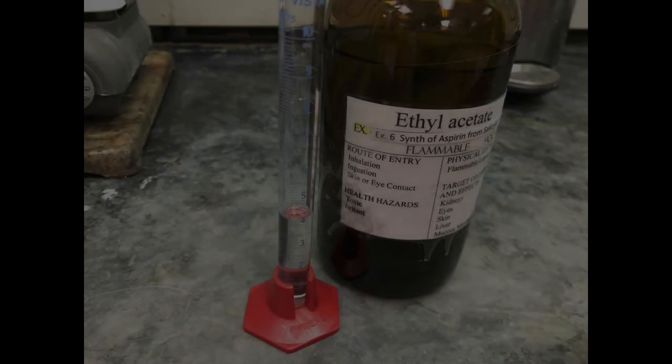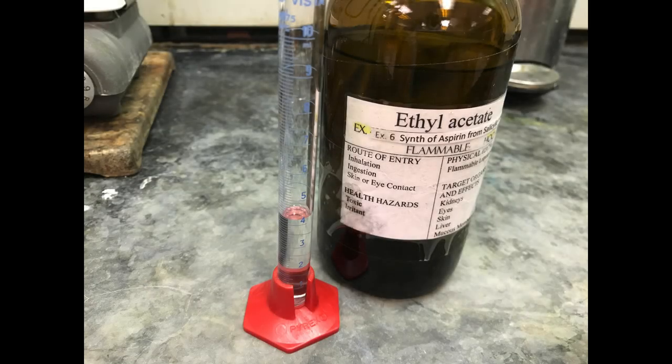It's time to dissolve the solid mixture in approximately 4 milliliters of ethyl acetate. The exact volume is not a critical measurement for this experiment. This is what the mixture looks like before mixing.